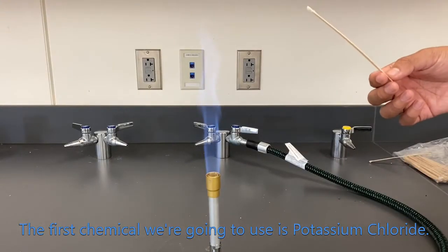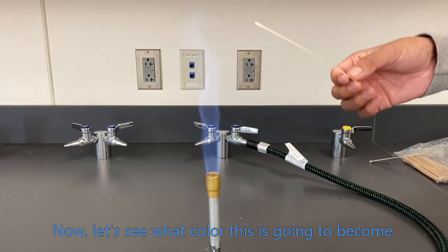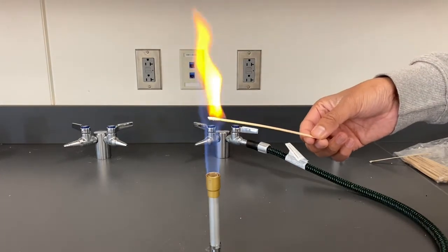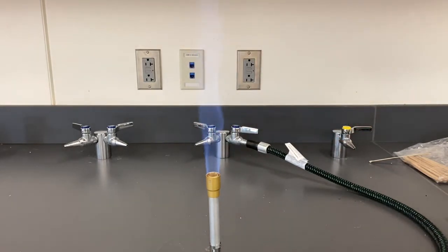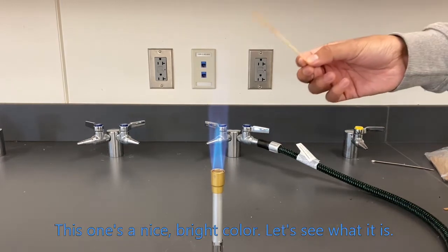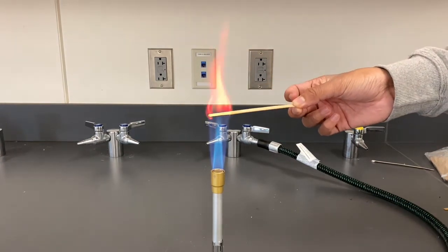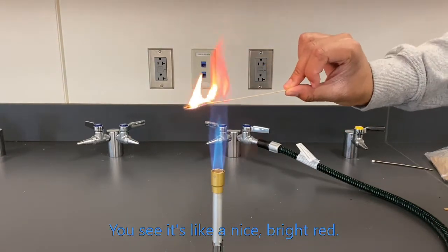The first chemical we're going to use is potassium chloride. Now let's see what color this is going to become. And that's a nice bright orange. Now we have a lithium chloride solution. This one's a nice bright color. Let's see what it is. You see it's like a nice bright red.